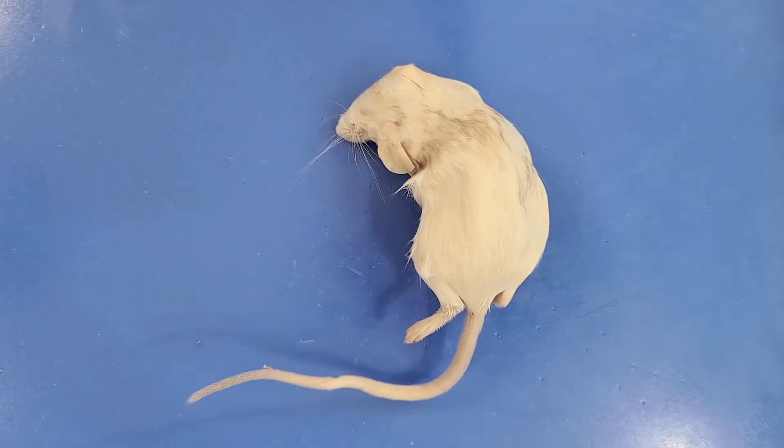Hello and welcome to O-Wyrm. Today we'll be taking a look at the anatomy of a mouse. A mouse dissection is a perfect way to show all the organs in the mammalian body. You will be able to see the circulatory system, respiratory system, and the digestive system through this dissection.